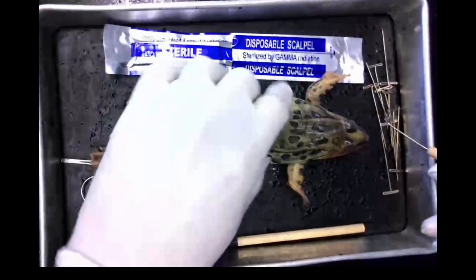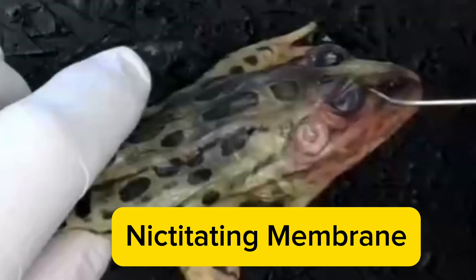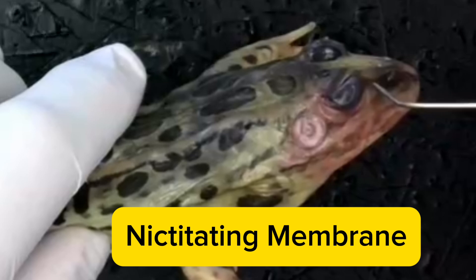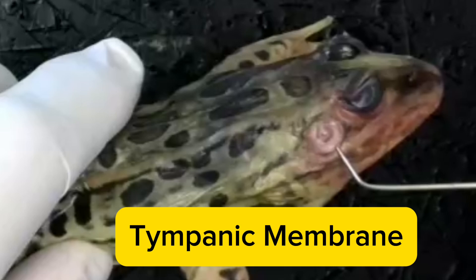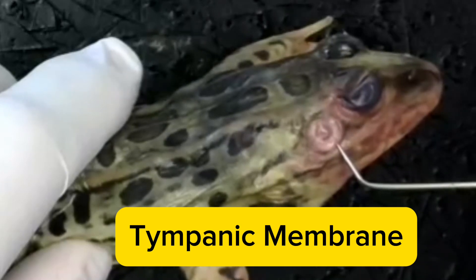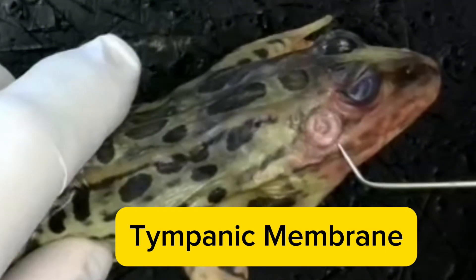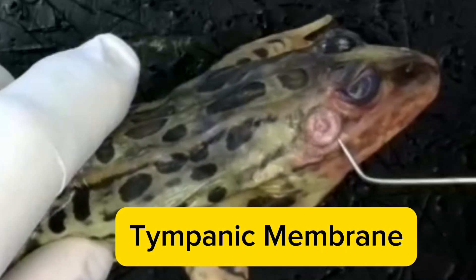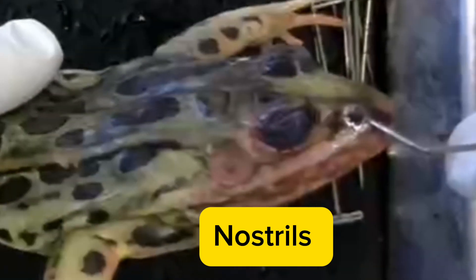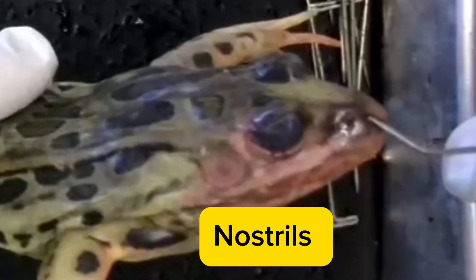Frogs have a special translucent eyelid known as the nictitating membrane that covers the eye and protects the frog when it's under water. The tympanic membrane, which serves as the frog's ear, is also specialized for swimming. Rather than a human ear, which would be open to water, the frog's tympanic membrane can detect sound waves like our eardrum. The nostrils are located on the front of its head, allowing for smelling and breathing.